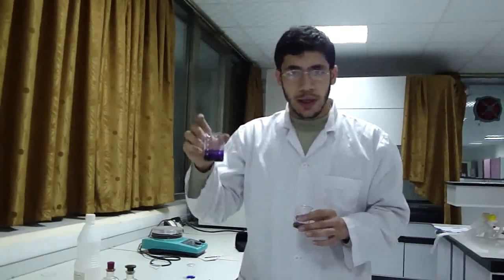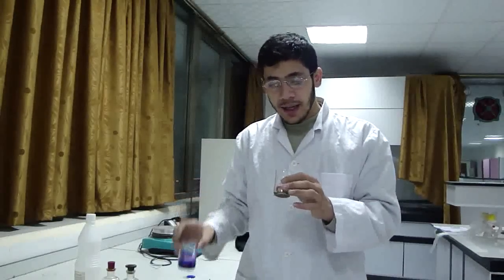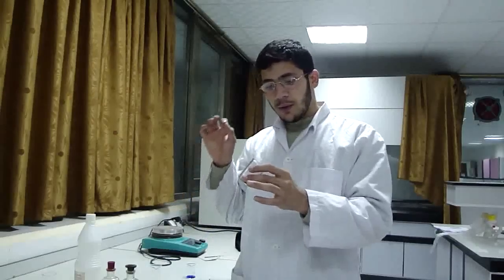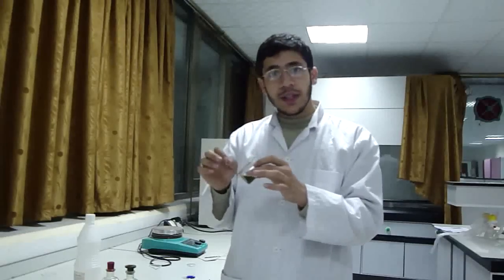The other fact: if we pass the sunlight through the beaker, we will see the shadow is violet, not green. I don't know why. I hope that someone helped me in discovering what is the explanation of this phenomenon.